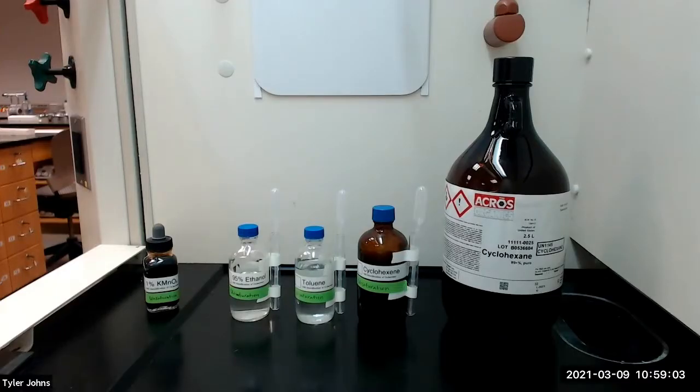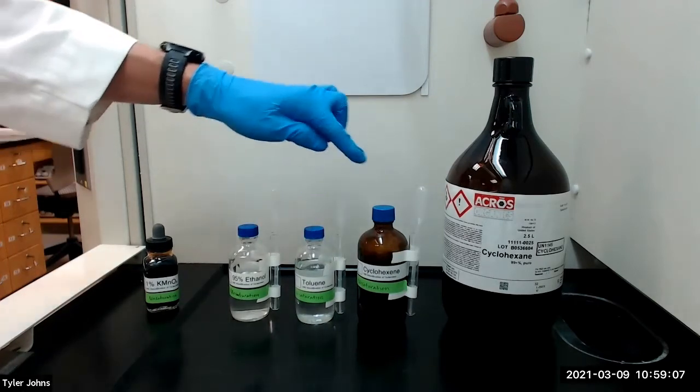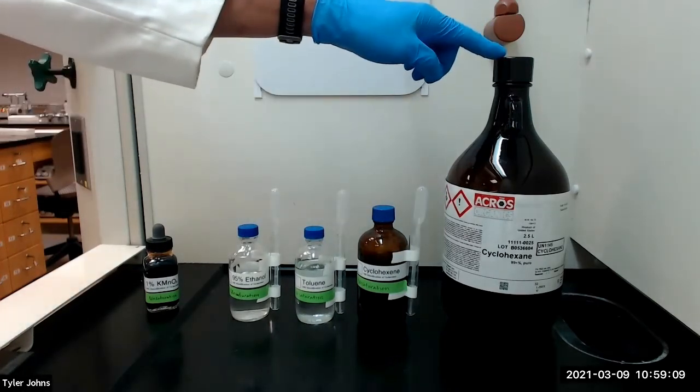We will practice the unsaturation test using three known compounds: toluene, cyclohexane, and cyclohexene.